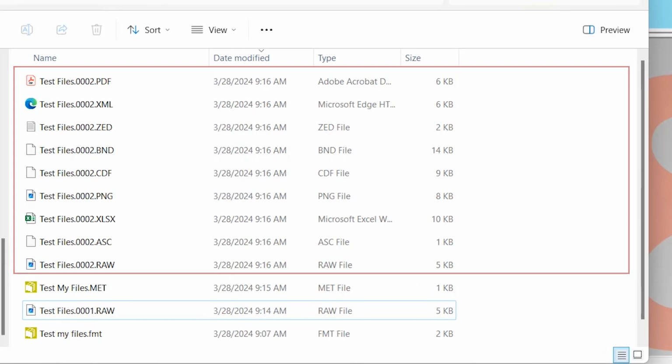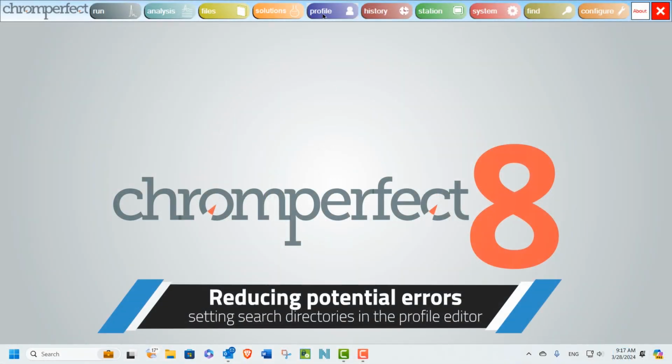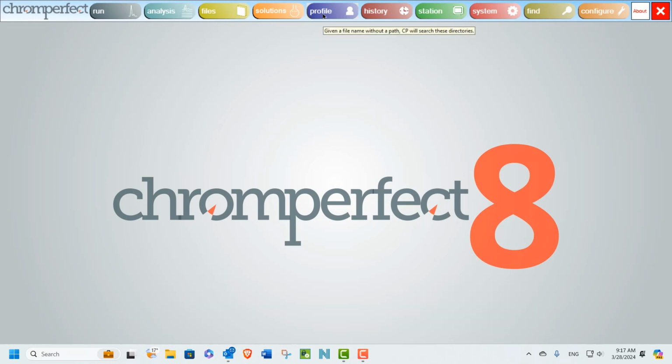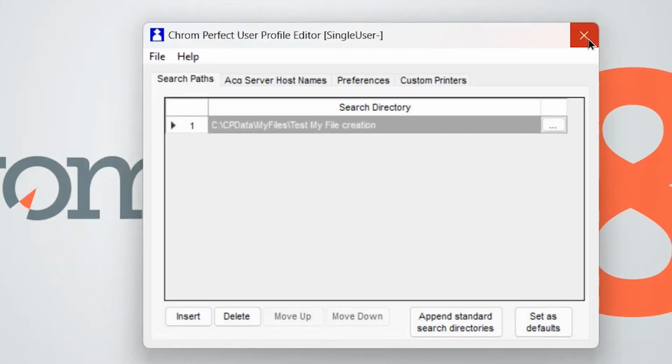And there they are. Before we end this video, let's cover a point of good practice by setting up the profile editor to include search directories where our method and other supporting files will be included. Let's open the profile editor from its button on the main menu. If a search directory is included in the profile editor, the user no longer needs to enter the full path and can simply enter the file name. Chromperfect will search for it during the processing phase within the target search directory.